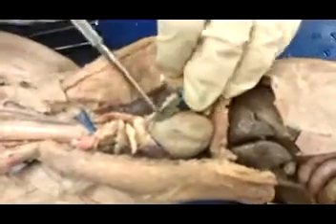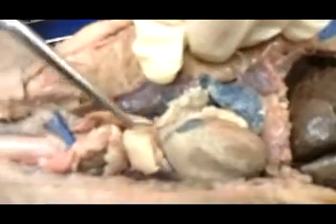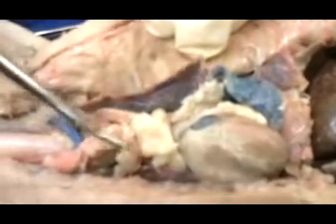This is the heart, and the heart is within a pericardial sac, which has been cut and pushed behind the heart here. Very tough connective tissue. And just superior to the heart is the thymus gland. Now this is going to be really big on young cats, and it shrinks up as the cat ages. It's the same thing in humans as well.